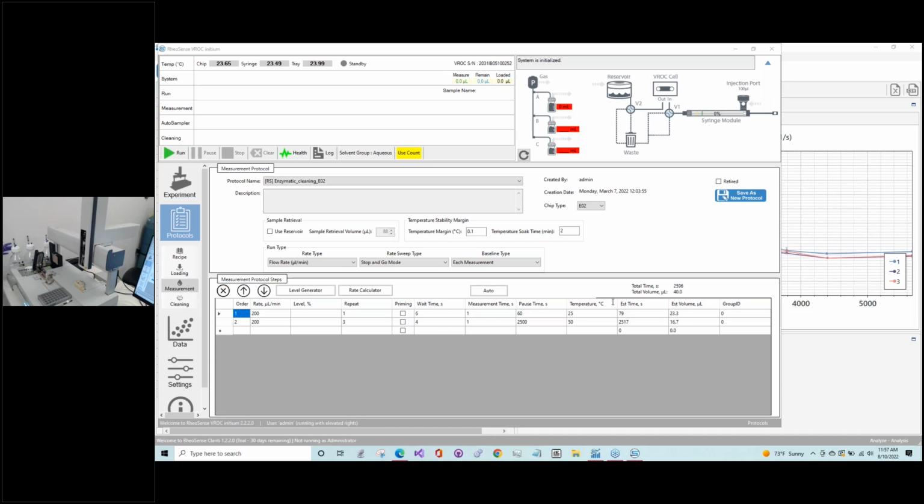If you are interested in using larger bottles than the size of the weight sensors obviously allows, we do offer a ledge, or a shelf, that sits over top of the weight sensors so that the bottles aren't teetering there and perhaps falling over. It's a little difficult to see because it's hiding behind here. This ledge will sit over the weight sensors, and you can then accommodate up to the 1 liter bottles. In that case, you can get through many more samples without having to refill those or worry about them running out.